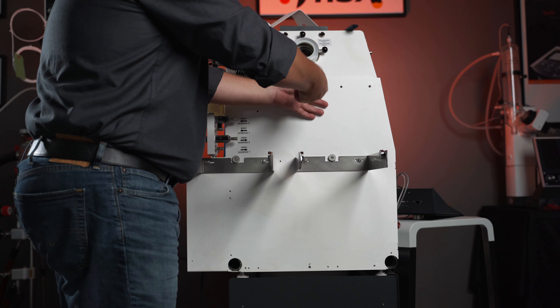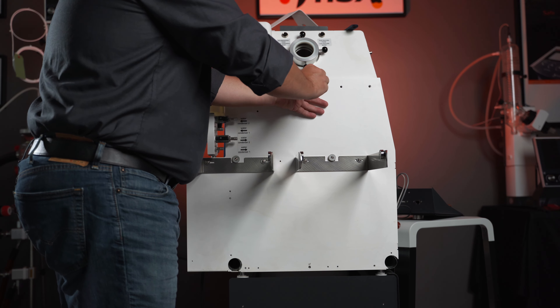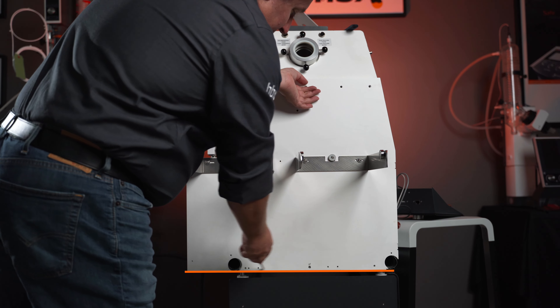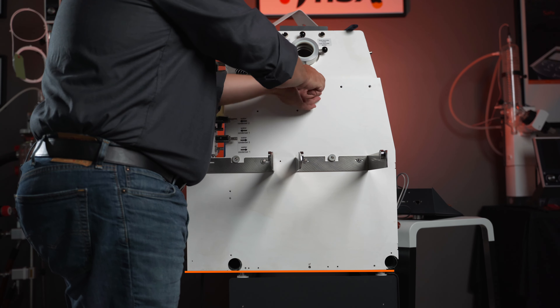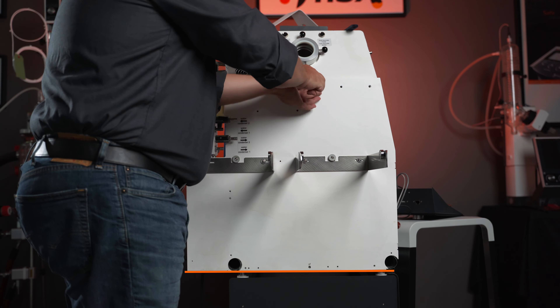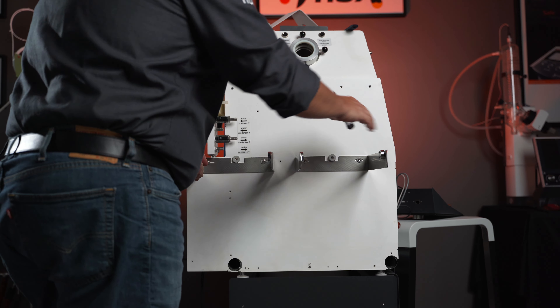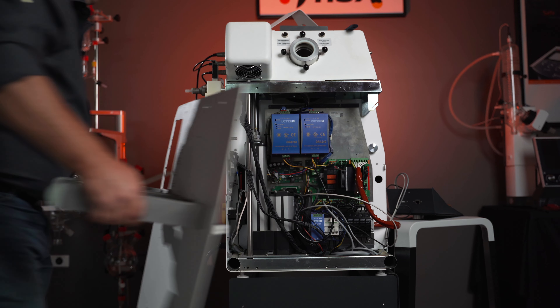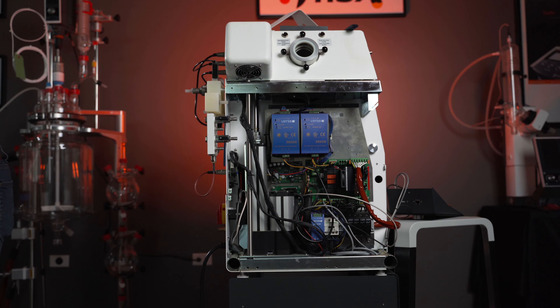When you're removing the final screw on the top, just keep your hand up and keep it pressed. This bottom panel is caught on a lip there, so that will support it for a little bit — but you don't want to just let this fall to the ground. Once you have all the screws removed, you can remove that panel and your electronics panel is exposed.